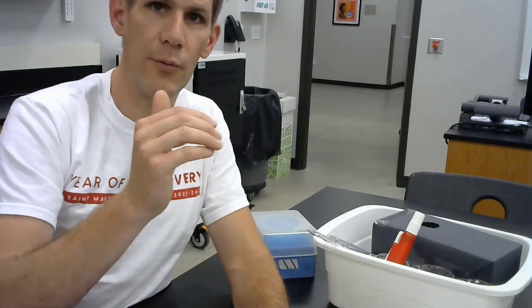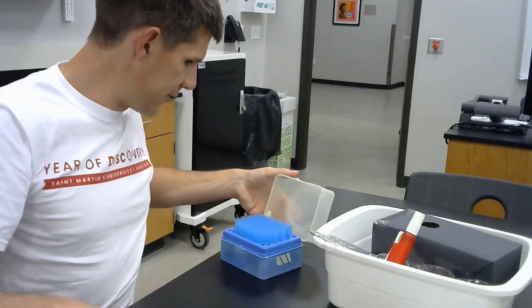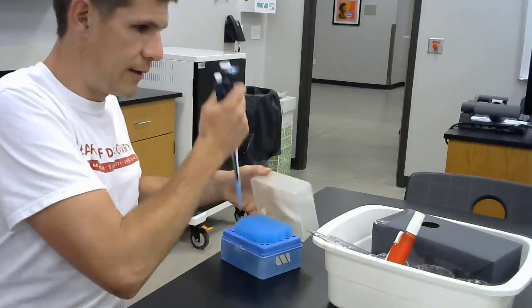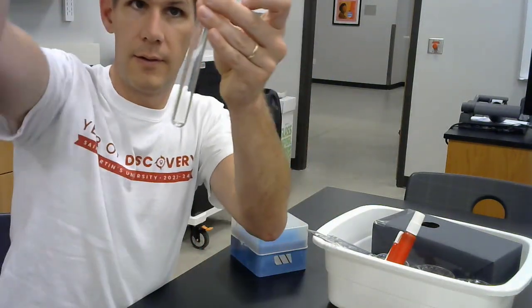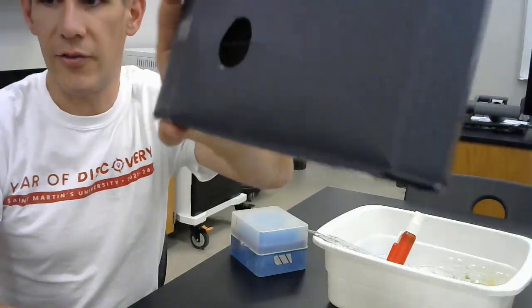So how fast the molecule moves in is how fast water will move in, and since we will be using red blood cells, they will explode when the water moves in. So we are going to pipette some red blood cells into a tube, and we are going to use this black box with a string and the tube in front of it.